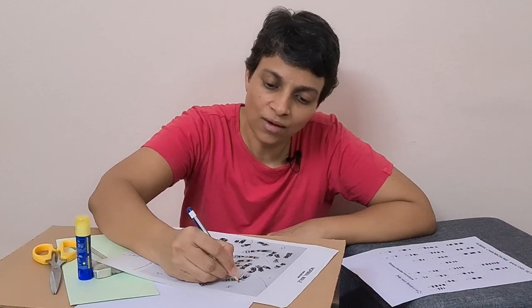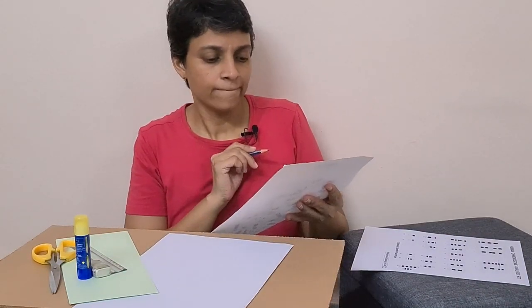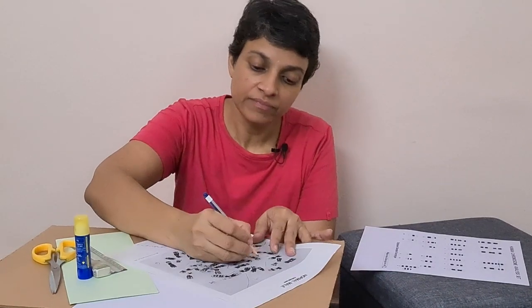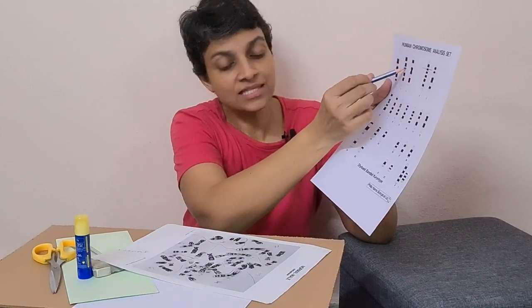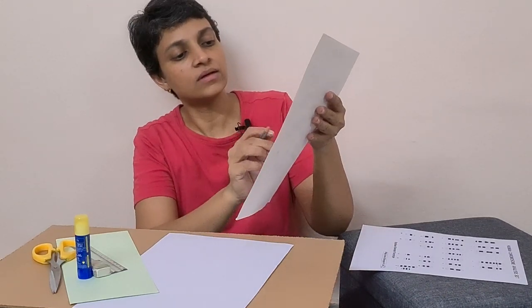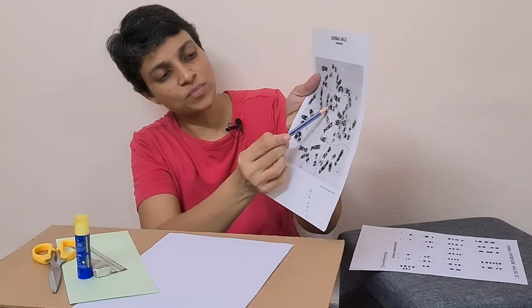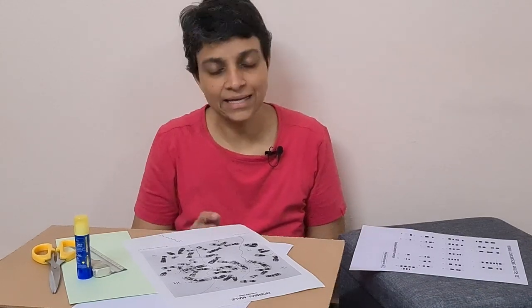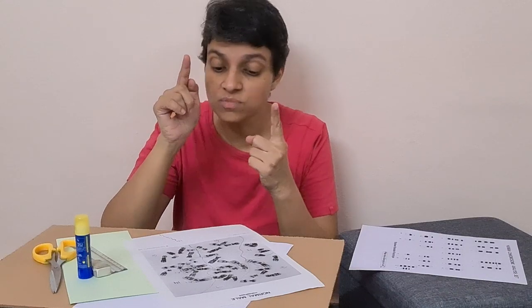Similarly, you compare the bands on A2 to identify the A2 pair. For A2, if you compare the bands — light, dark, light at the centromere with a darker band — you find your A2 pair. You do the same for A3.